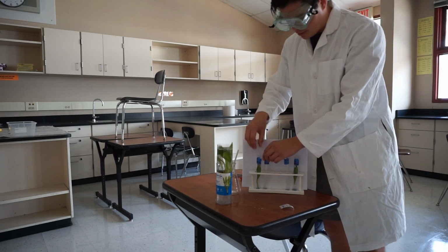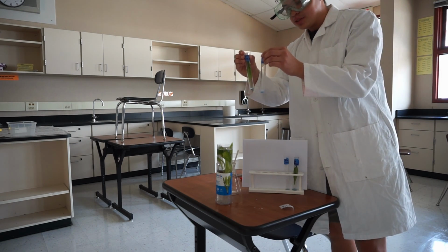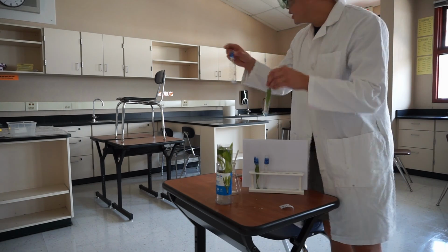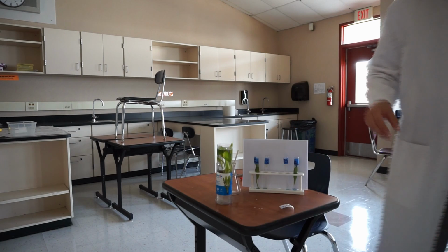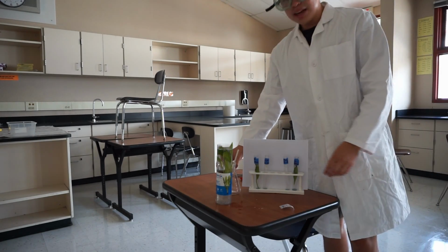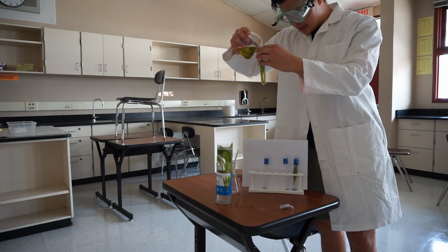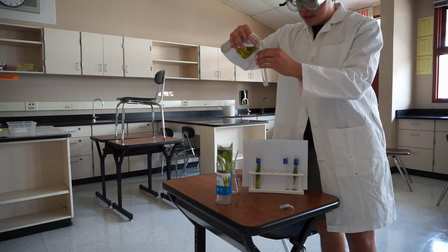To notice the effect of light on these test tubes, two of them are going to be put underneath direct light, and the other two are going to be put in darkness, in that cabinet right there next to the dispenser. I'm going to fill them up with the bromothymol blue and carbon dioxide solution, and then we're going to notice what happens after a day. Keeping our control variables the same, I'm going to put about the same amount of solution into each of these vials.